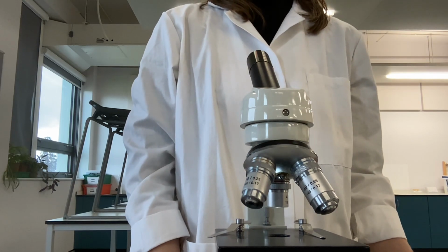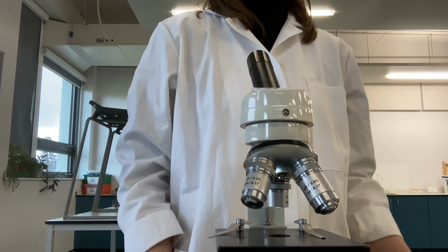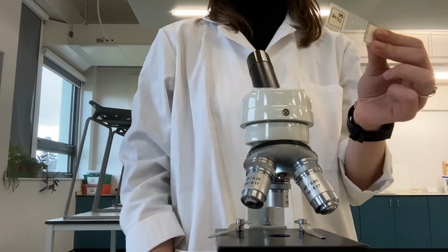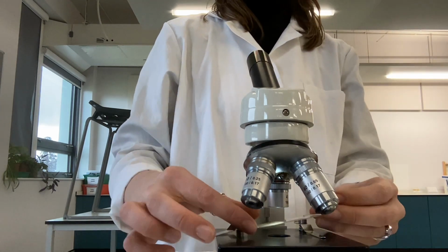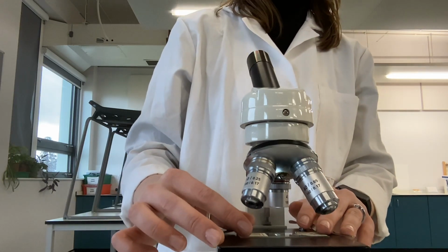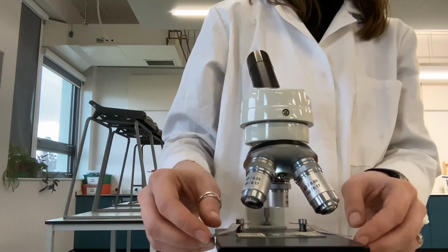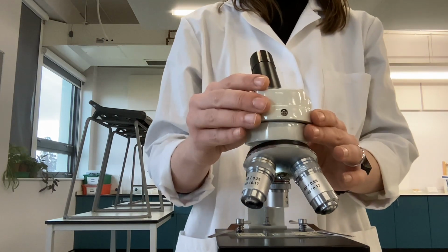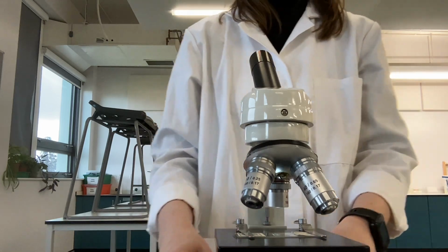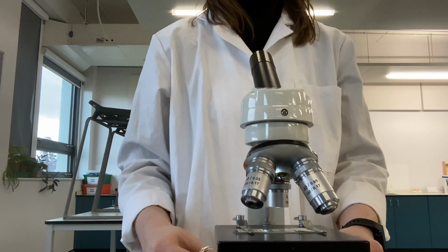Once our microscope has been fully calibrated for each of the 3 objective lenses, we need to make sure that we return it to the ×4 magnification. We can then collect a slide showing the stages of mitosis, and we will place it onto the stage. When placing your microscope slide onto the stage, you want to try and see the stained coloured cells through the light source, as this will help you locate when looking through the eyepiece lens. When you think it is in place, put the clips onto the side and then use the focusing wheels looking through the eyepiece lens to ensure that you can see everything clearly.